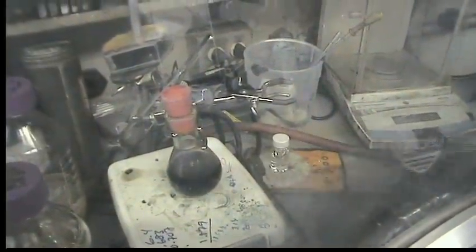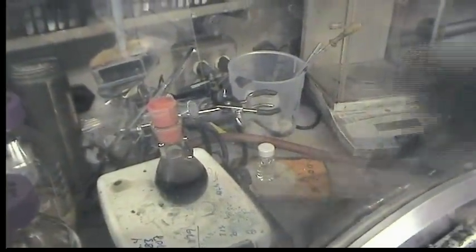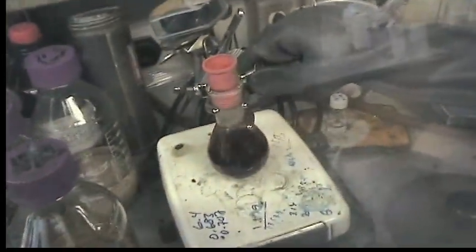But once we filter it, we're going to get a bright orange solution. We've got an hour and our reaction mixture looks pretty orange and heterogeneous.